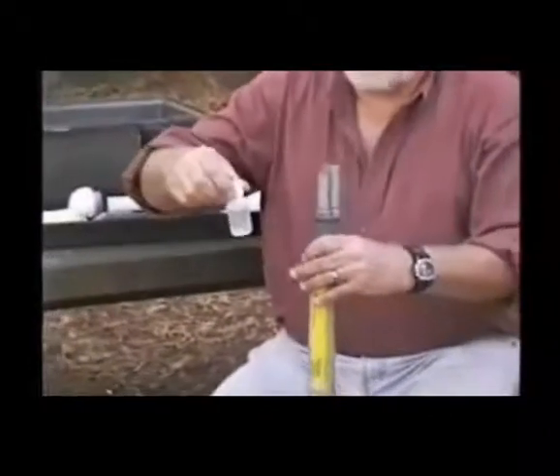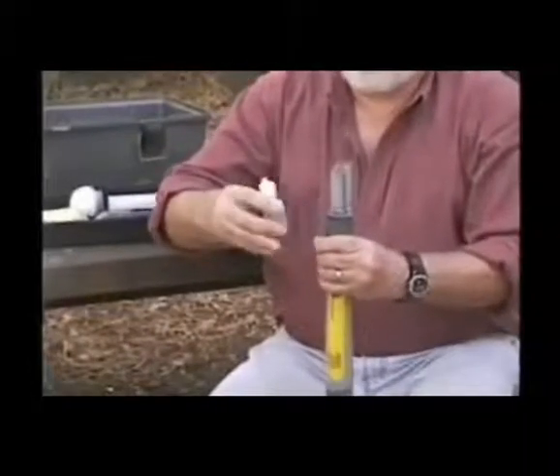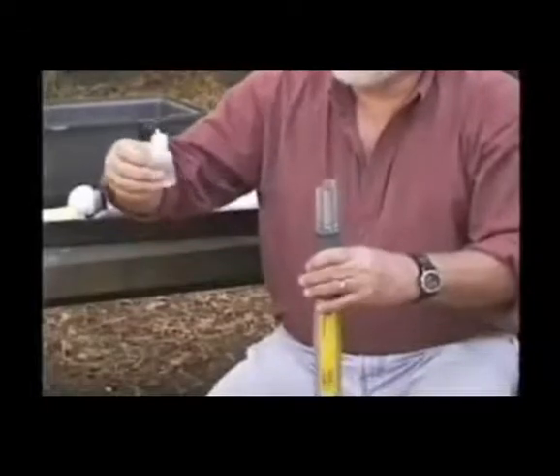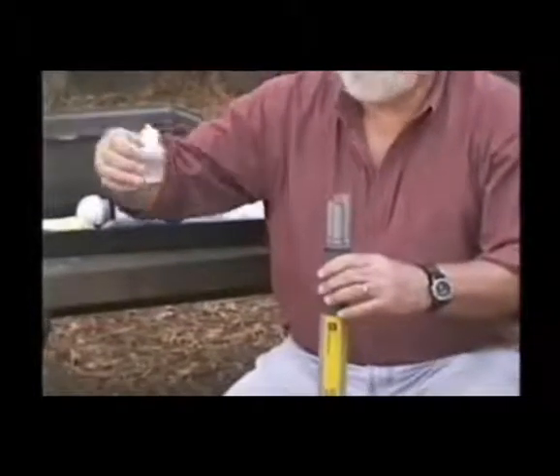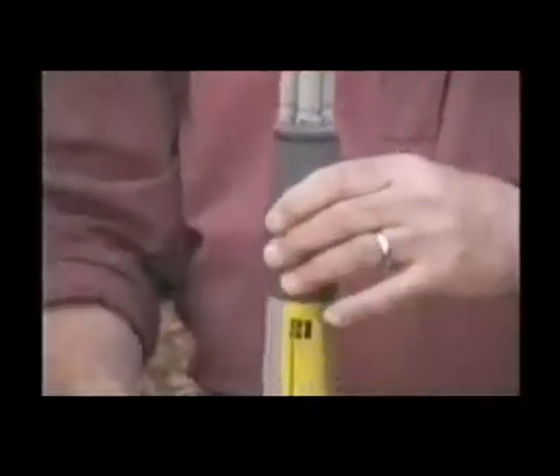So the first thing we need to do is prepare the electrolyte, which comes dry, and we simply add deionized water, mix it, and we have the electrolyte. The electrolyte is then put on the dissolved oxygen membrane until it forms a positive meniscus. I think you can see that. There's a tiny bubble. We don't want any bubbles in there. So you can see that meniscus, that positive meniscus.